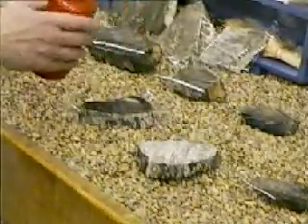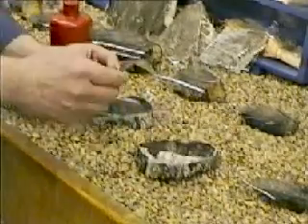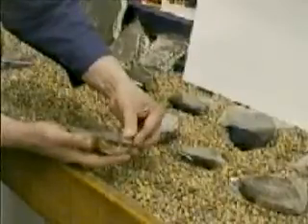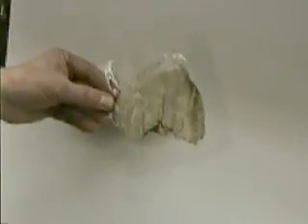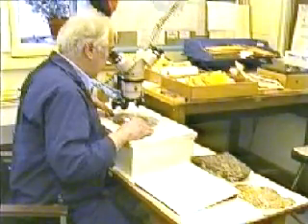Once again acetone may be used to flood the surface of the block, and a clear sheet of cellulose acetate is placed over the surface of the specimen. The acetone dissolves the surface of the acetate sheet to allow the tops of the elevated specimens to become embedded in the sheet. After drying, the acetate can be peeled from the surface and is sufficiently thin that it can be studied with light microscopy for the identification of structures.